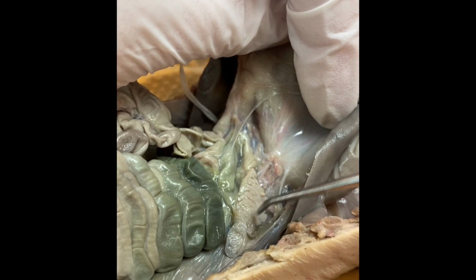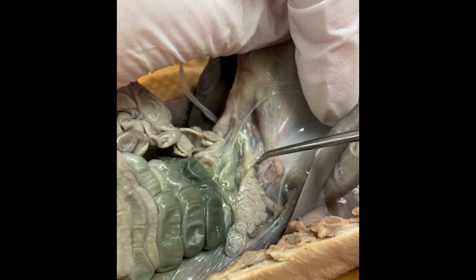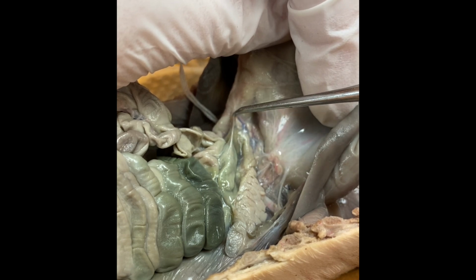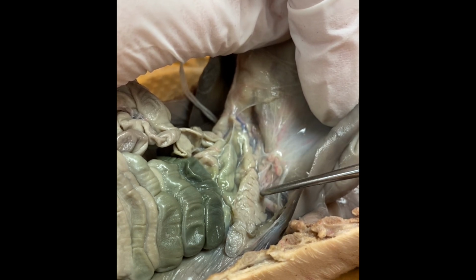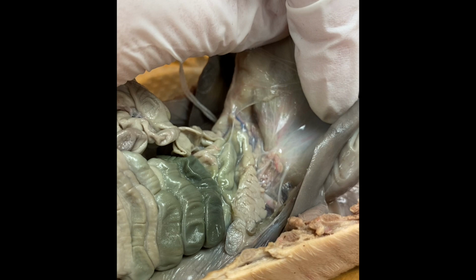The pancreas is responsible for secreting many, many different enzymes into the small intestine that first comes off of the stomach, called the duodenum. And this is a structure that you want to look into a little bit more closely and discover what enzymes it actually makes and what those enzymes are responsible for doing.